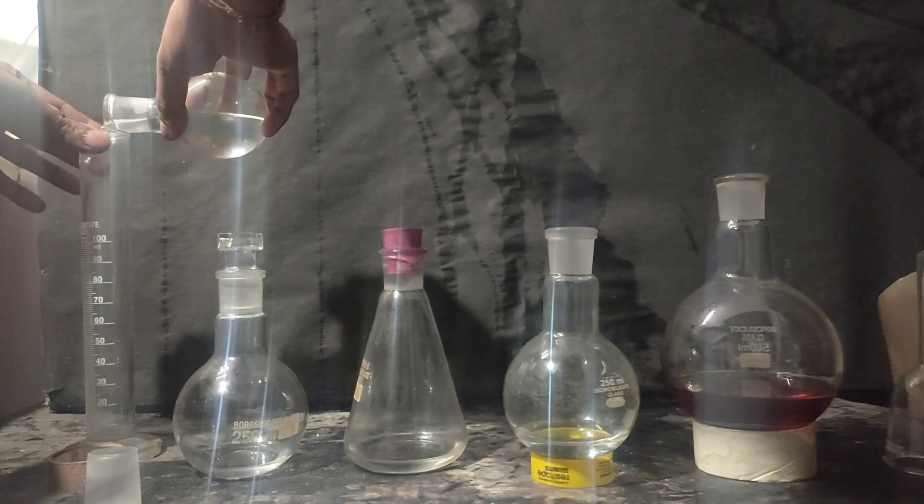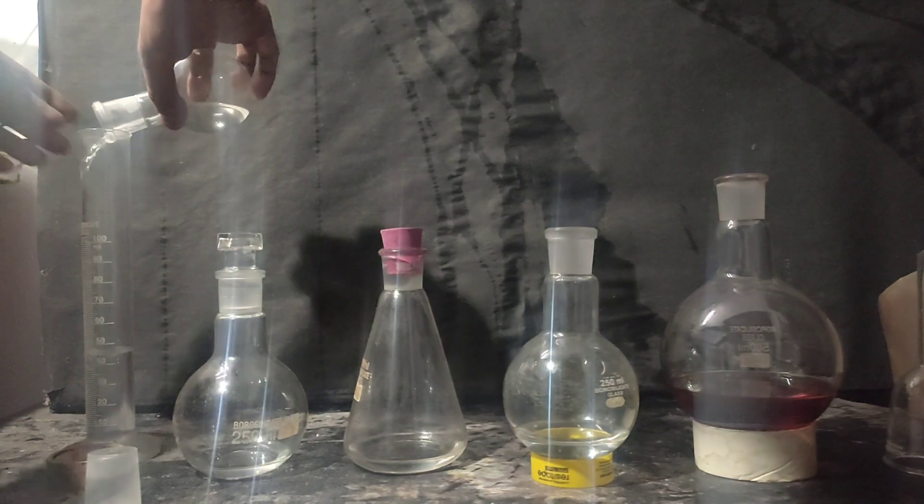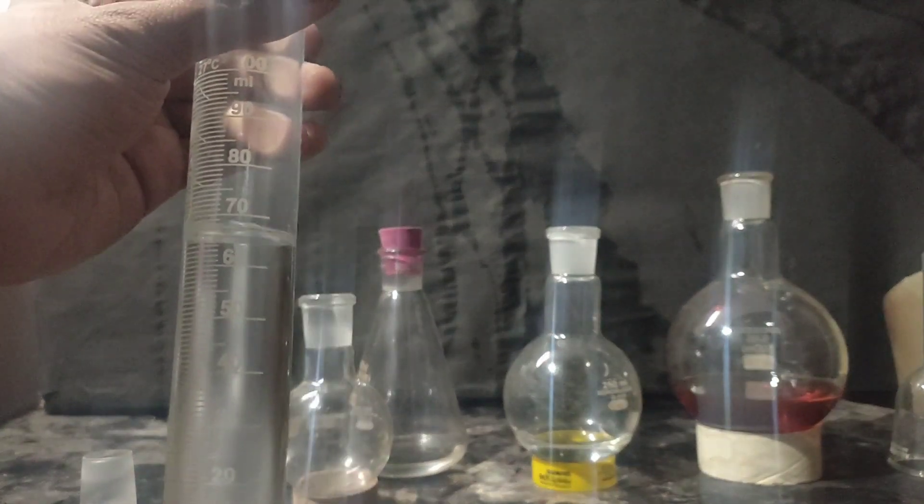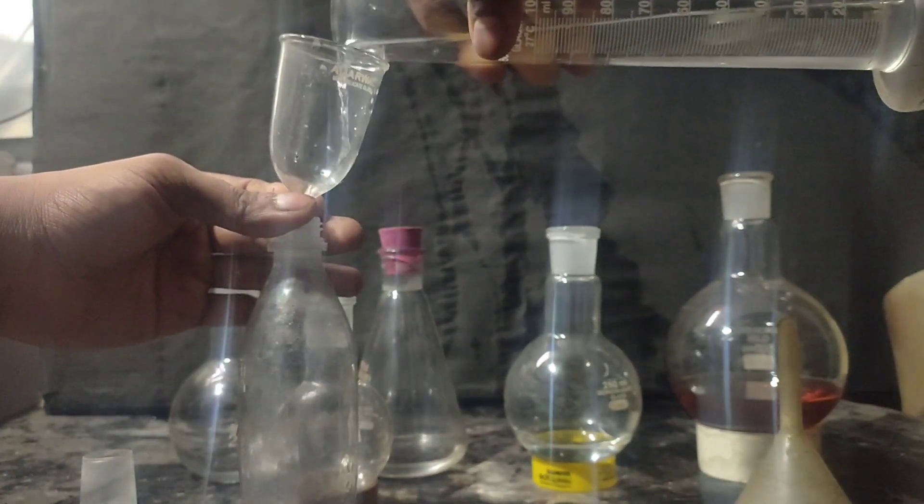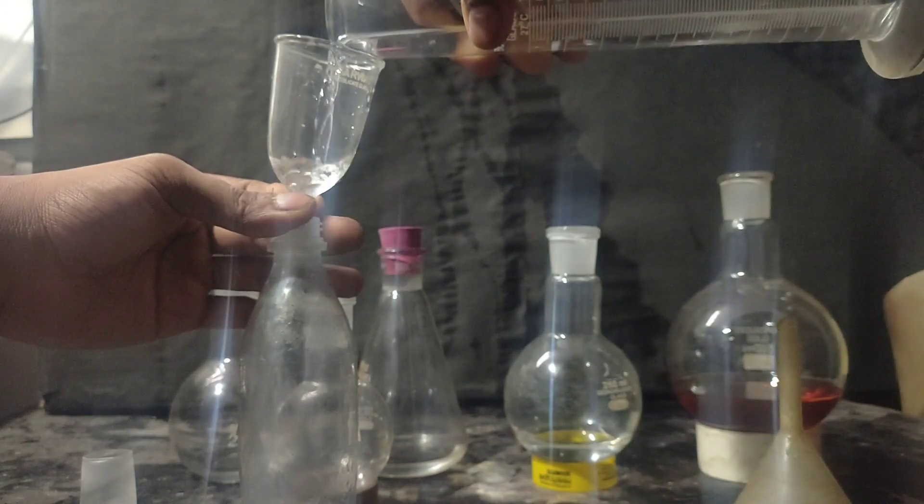Its volume was the highest of all the four fractions. I transferred this fraction into an airtight cold drink bottle.